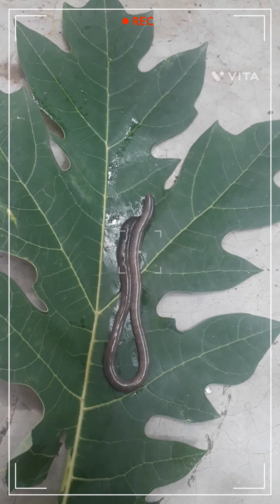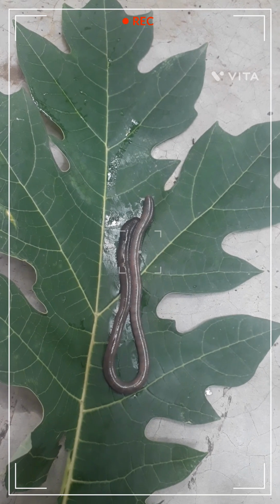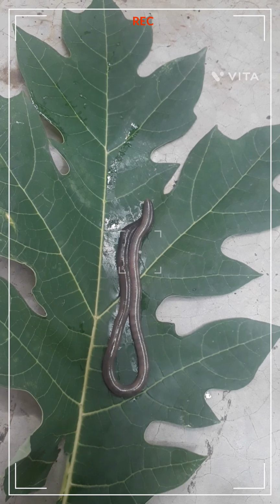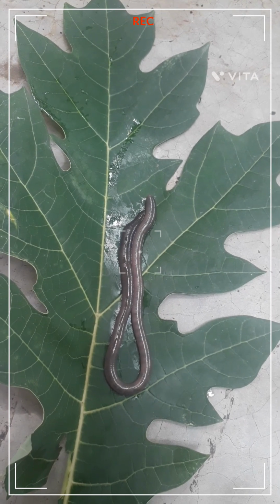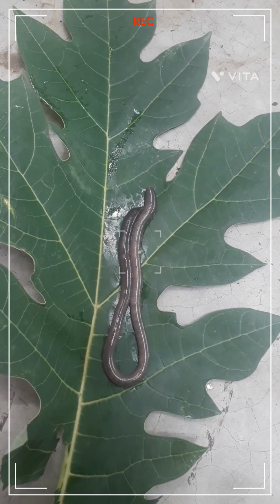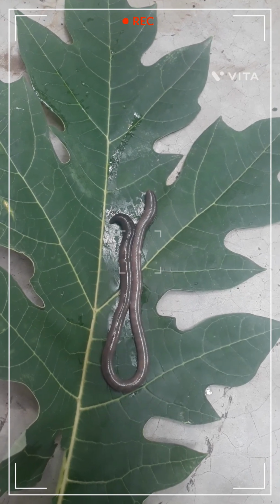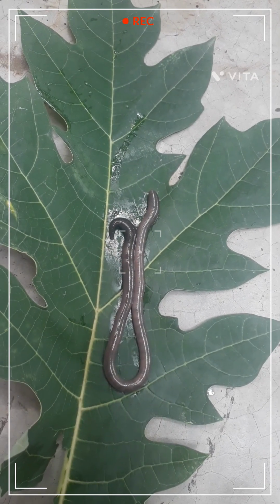I remembered my biology chapter, structural organization in animals. So I took the earthworm and started to dissect it. The scientific name of the earthworm is Pheretima posthuma. Pheretima represents the genus and posthuma represents the species.